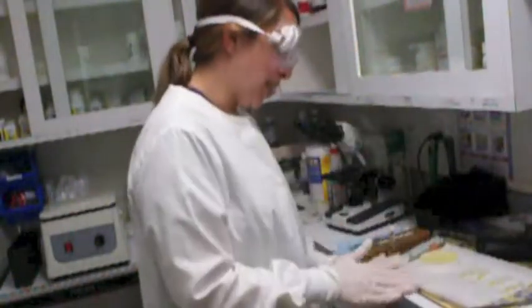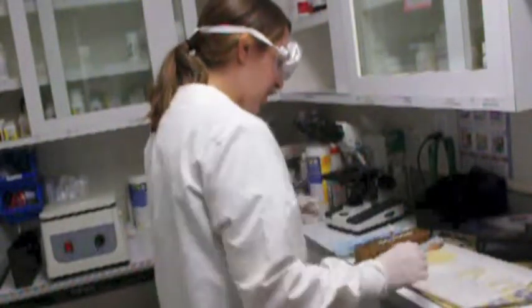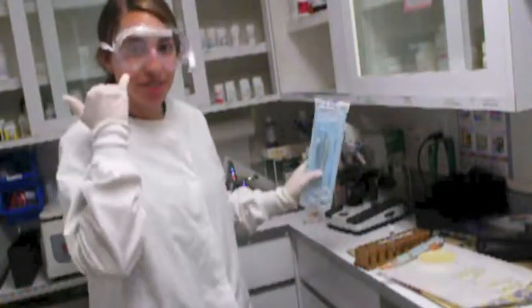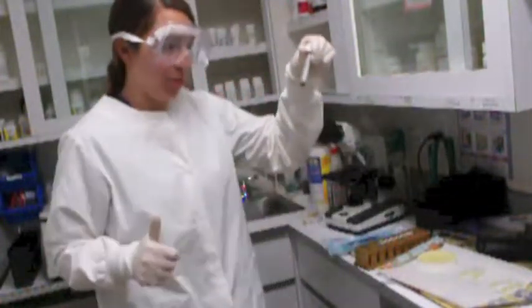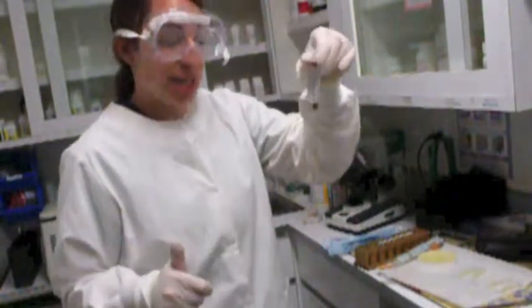So I have all my supplies here. I have my antibacterial disc, I have my agar plate, I have my sample, which is in here, I have a sterile culture swab, and I have hemostats. So here is my disc here. You want to make sure everything's sterile. This is a sample that was taken from a growth on a dog, sterilely.